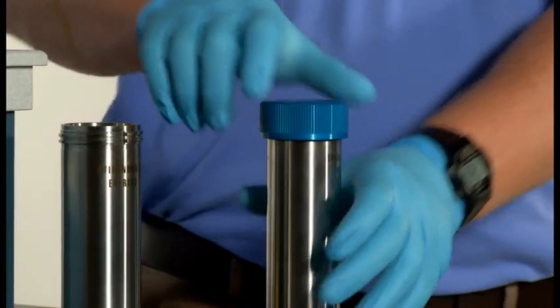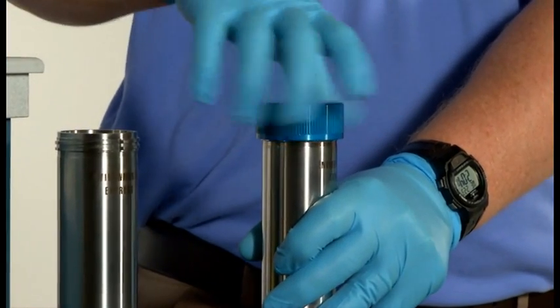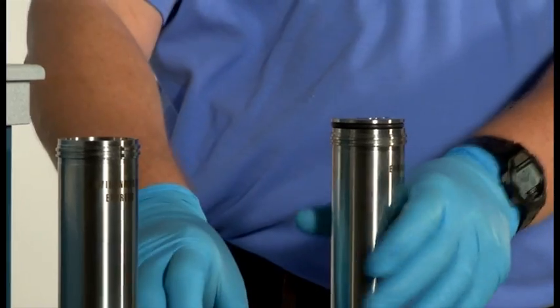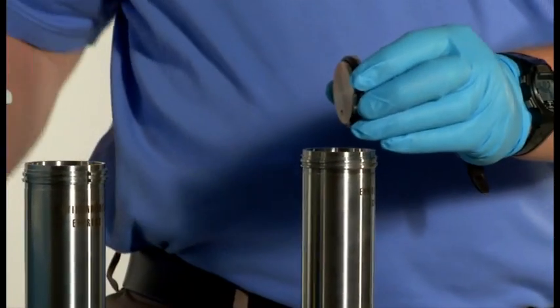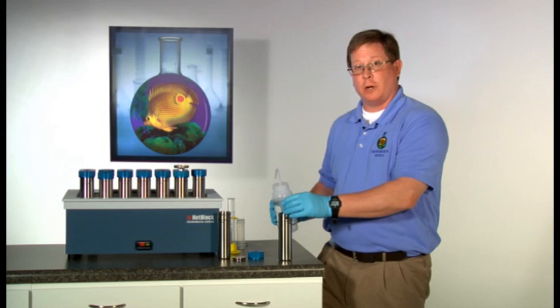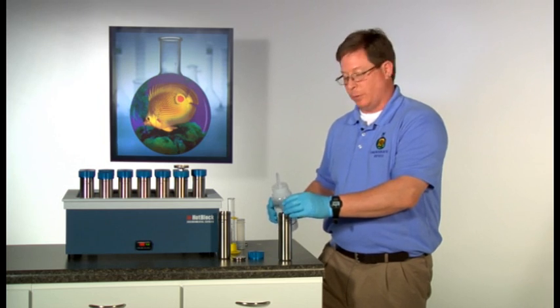Once the cell is cooled, unscrew the outer threaded cap and remove the stainless steel inner lid. Rinse the inner lid with the appropriate solvent, taking care to collect the solvent within the cell.